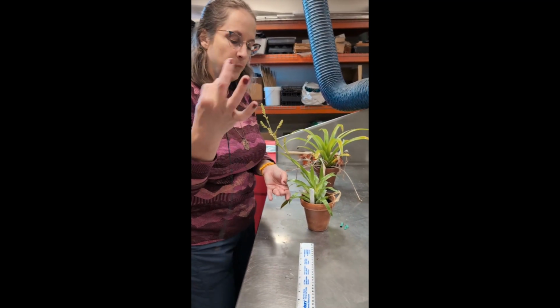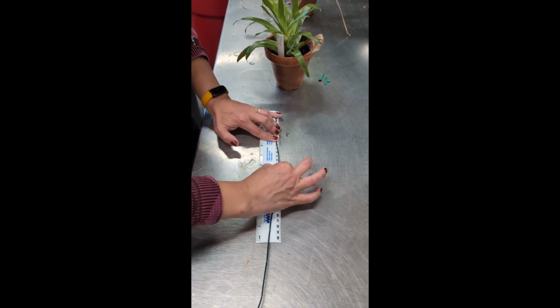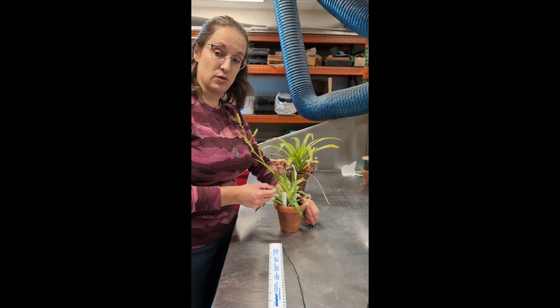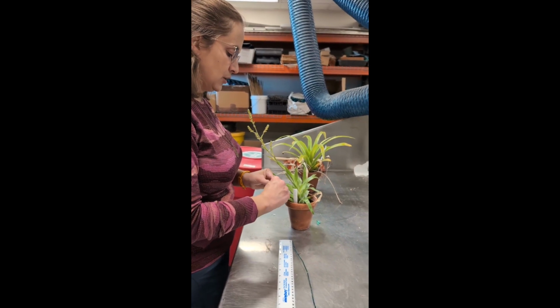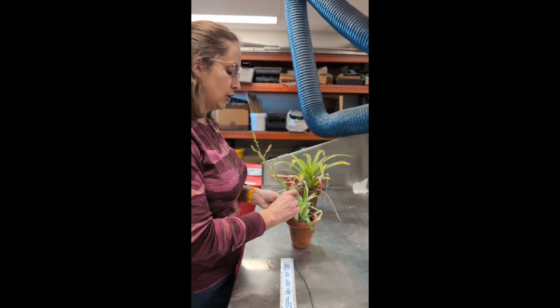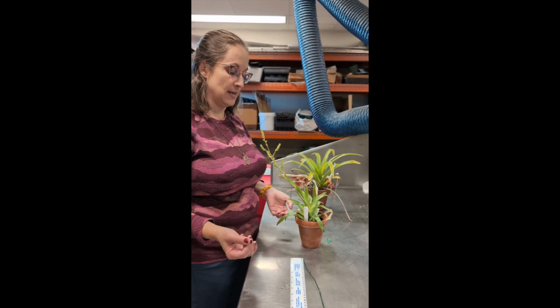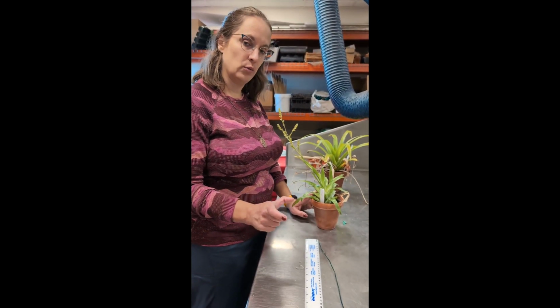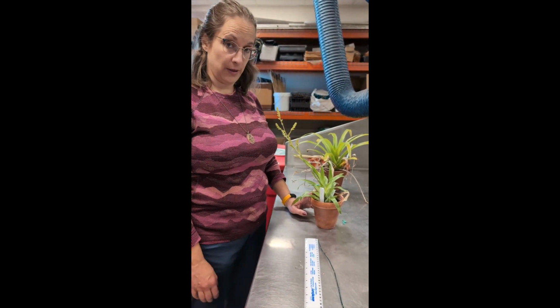So again, with that firm pinch, running along on my ruler to 170 millimeters. And I have these little twist ties. You could use a hair tie or a rubber band or something like that. I'm going to use that to mark which leaf it is, and I might record it in my notebook. 170 millimeters is the longest leaf on this individual on this day. And I'd keep very close tabs on the label, which plant I am taking data on. Okay, so that's longest leaf length.